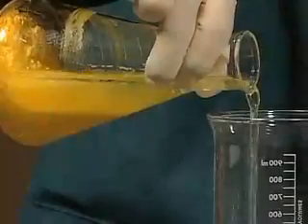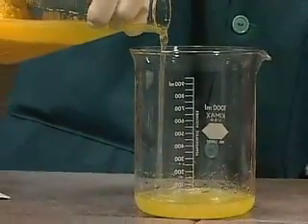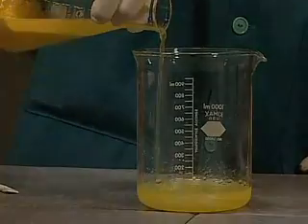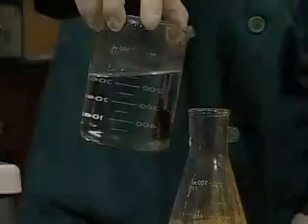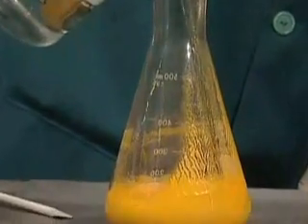The investigation begins by decanting and washing the lead-2-iodide precipitate. Deionized water is then added to the pure solid lead-2-iodide.